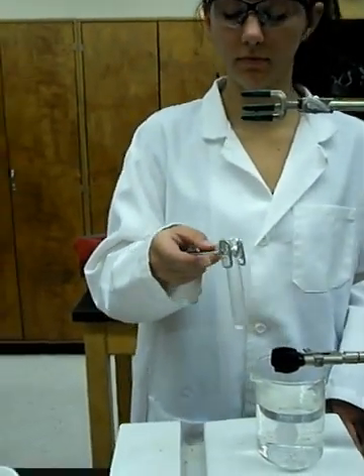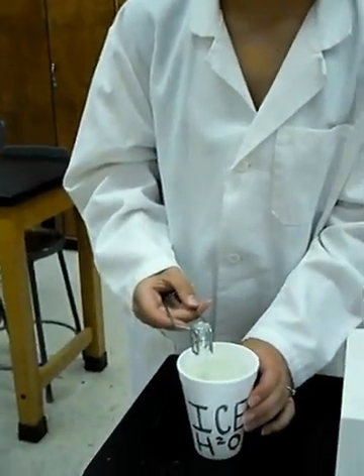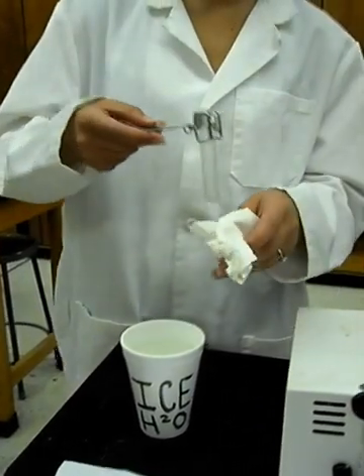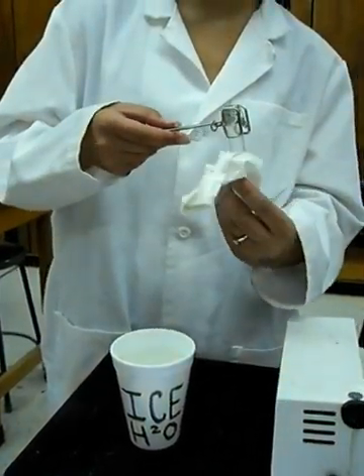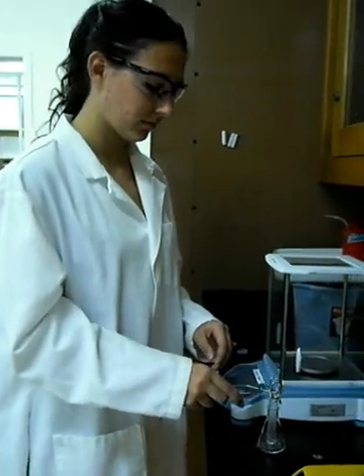Quickly transfer the test tube to the ice water bath. Cool the test tube for about 1 minute. Remove it and dry it completely. Measure the mass of the test tube and the aluminum foil top.